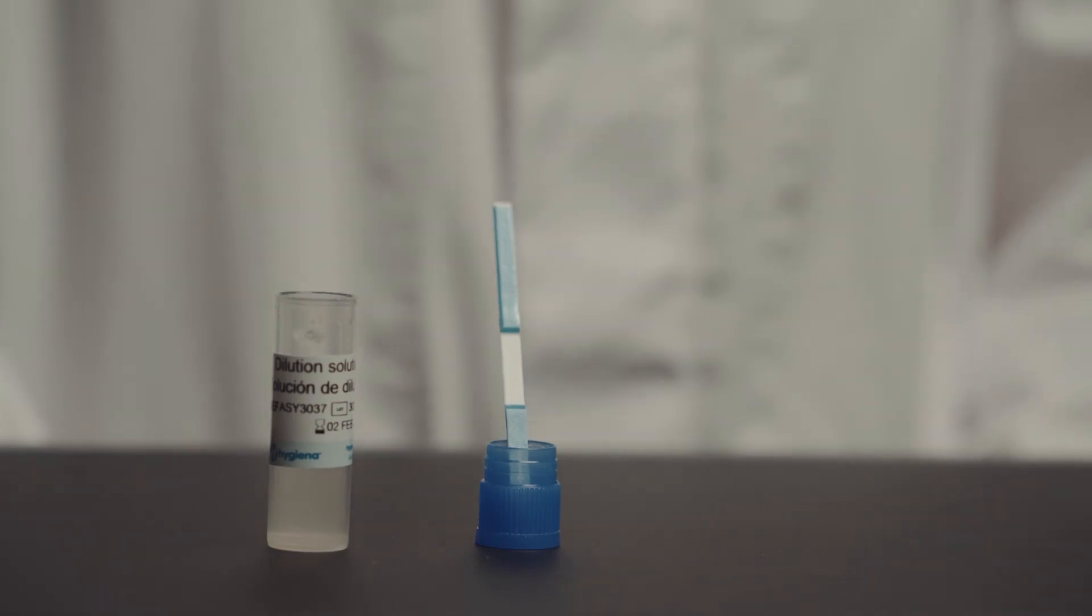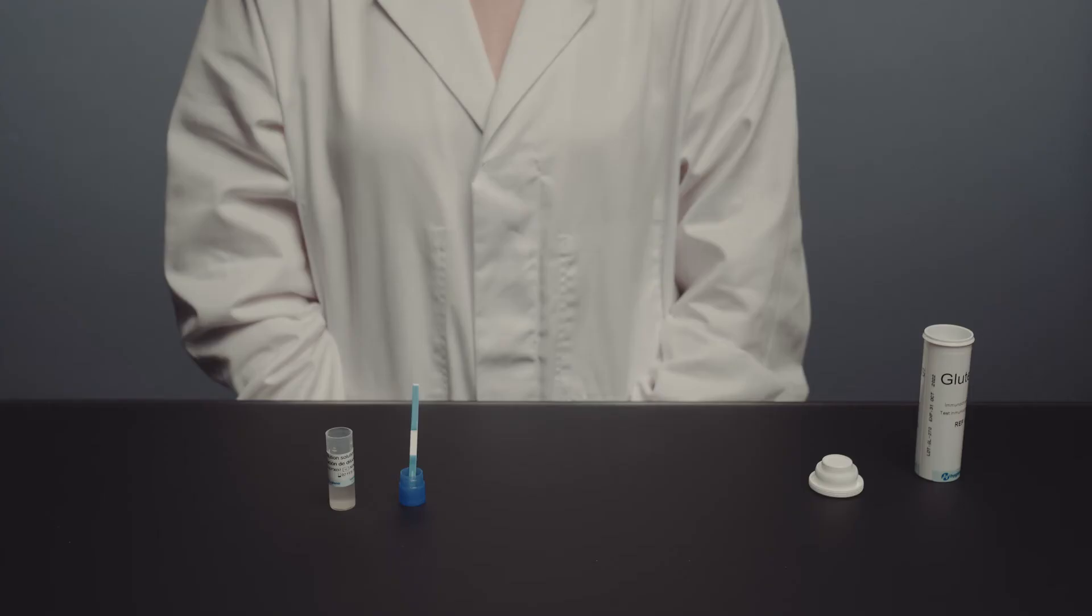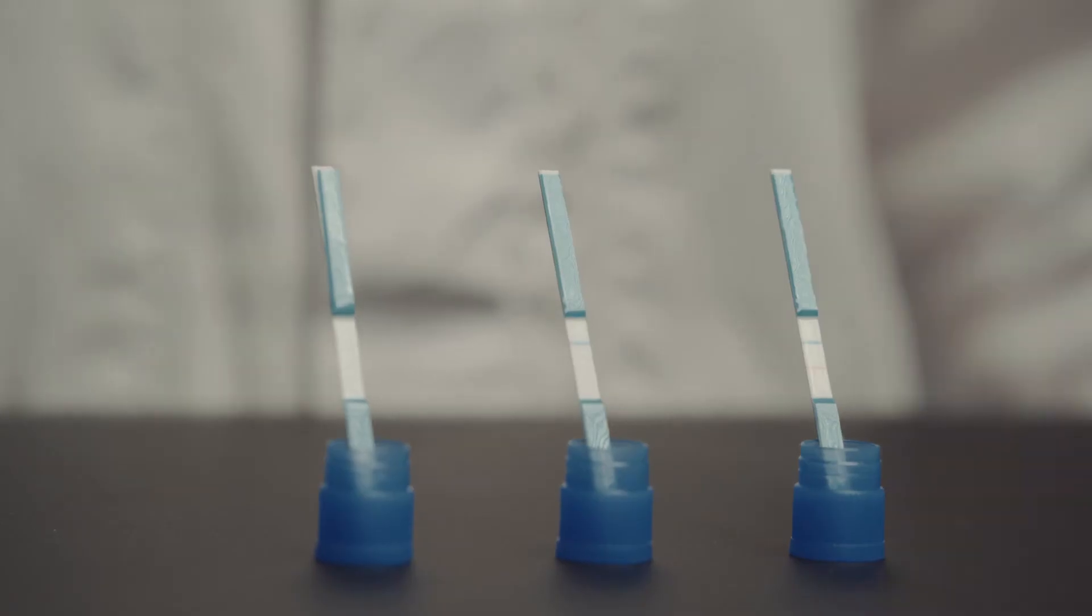Step 10, allow the test to run for 10 minutes. It is important to check the results at the 10 minute mark. Step 11, read the results.